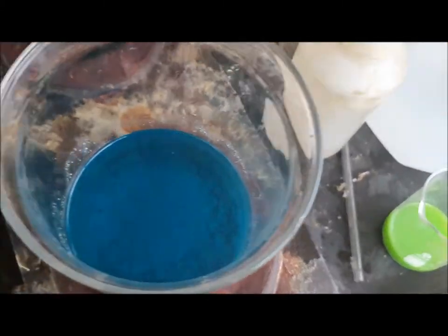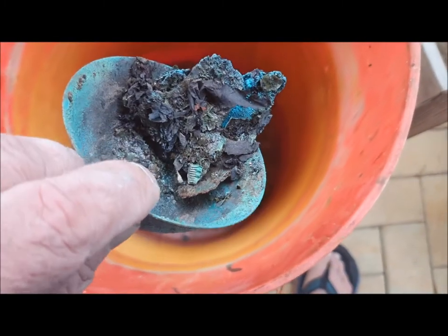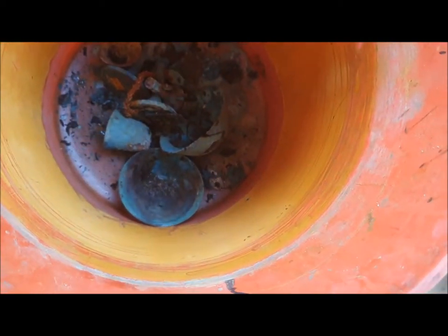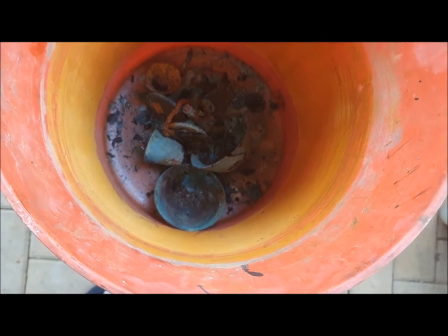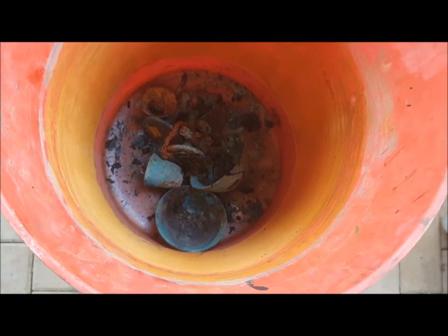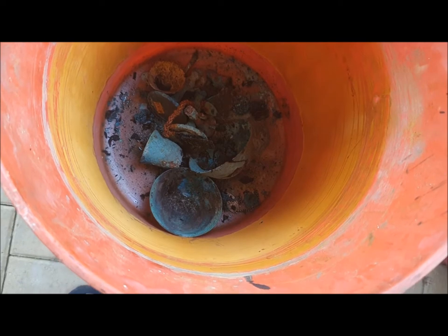There'll still be some free nitric acid in there. I've got silver-plated copper pieces here — I've already had these in nitric before. The best thing about this is that copper is what's needed to drop the silver out of solution. When I put free nitric acid in here, it will dissolve the remaining silver as well as some copper. And then once there's no more free nitric, the copper will keep going into solution to drop the silver out. So eventually, once I've put enough free nitric in, all the silver will dissolve and the copper will make it all fall out of solution.